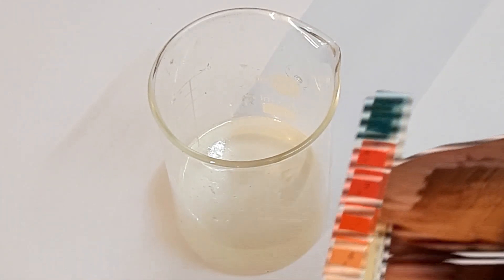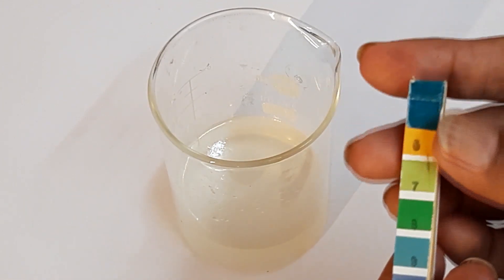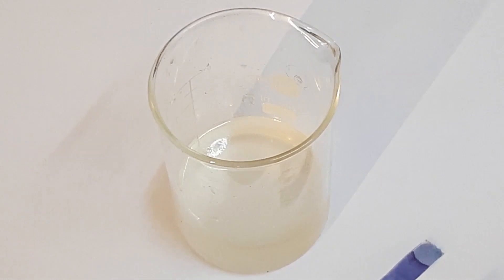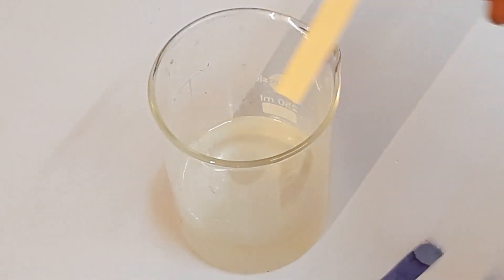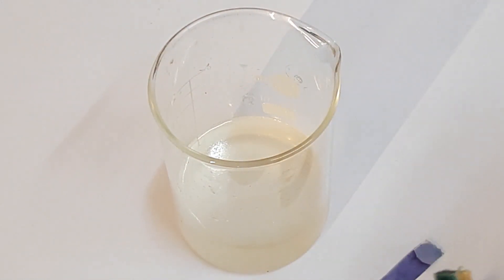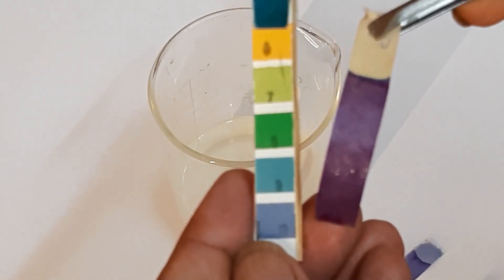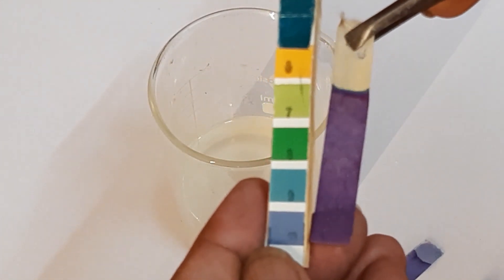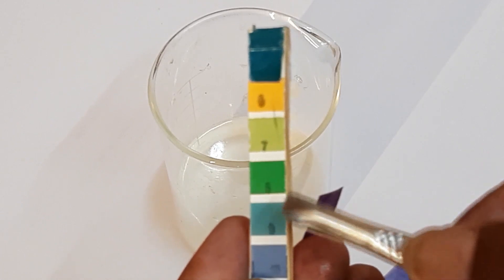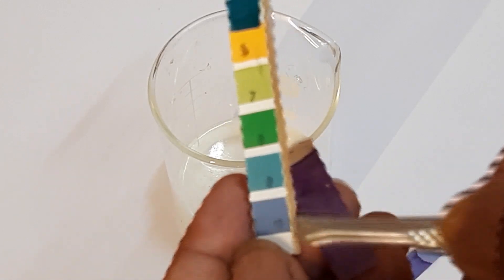Now I have a pH paper. You see the different colors on it indicate the pH of each value. I will remove one sheet and dip it in the solution. You will see that it has turned, and putting it against the scale you will see that our pH is very close to 10.